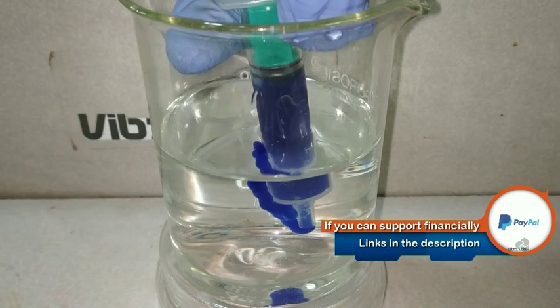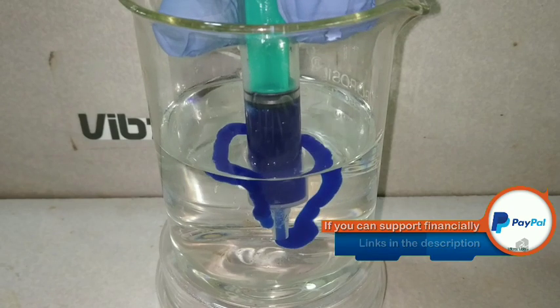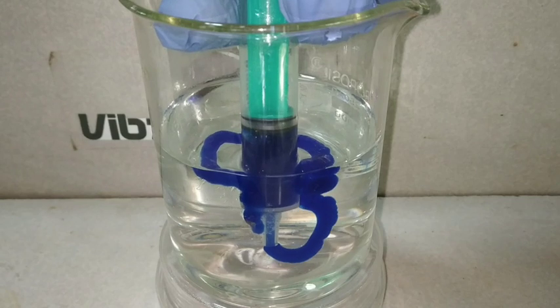The polymer is precipitating out because the acid will react with the ammonia and a neutralization reaction takes place, leaving behind the cellulose.